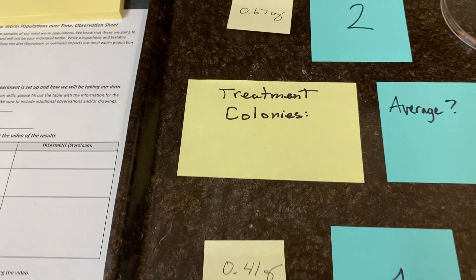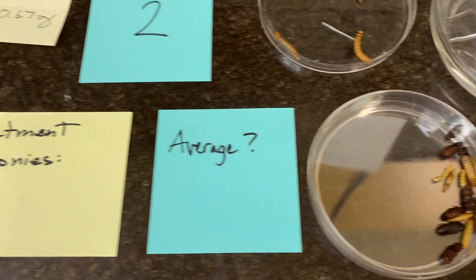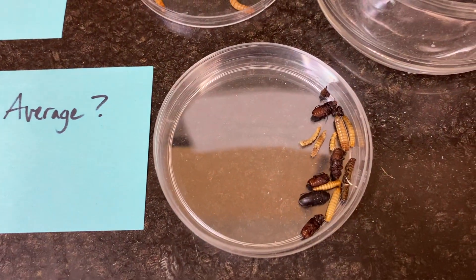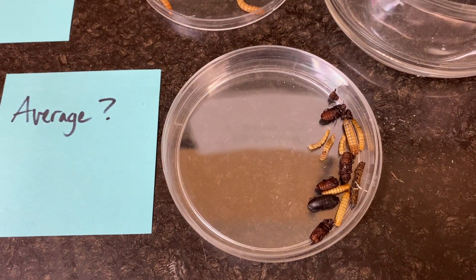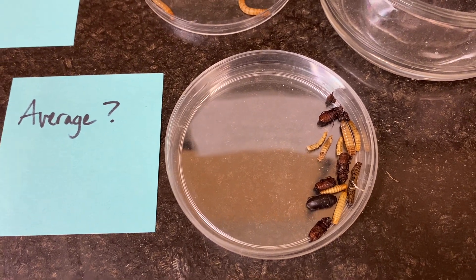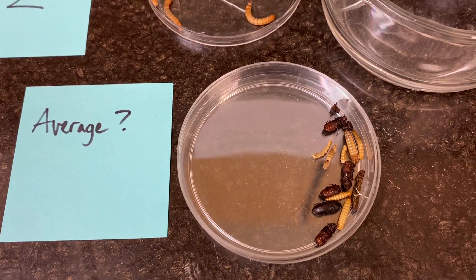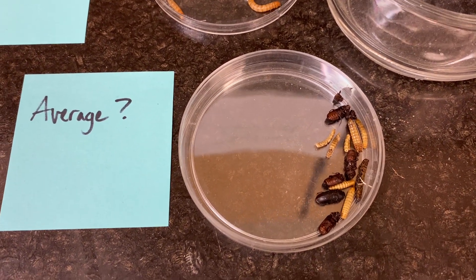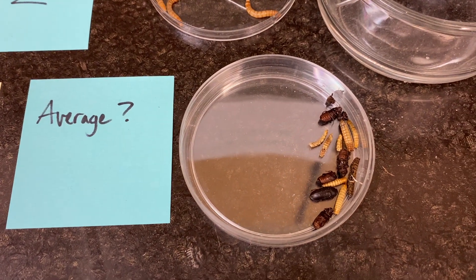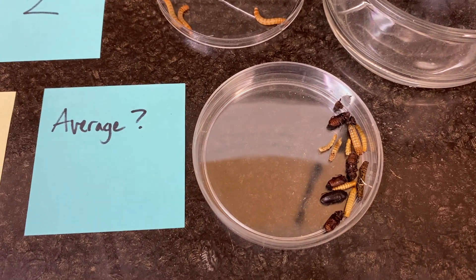All right, now we're coming over to the treatment colony. Just keep in mind — there are a lot more dead mealworms on this side, which is the treatment side with the styrofoam, than there were on the control side. Just something to keep in mind as you look at survivorship.